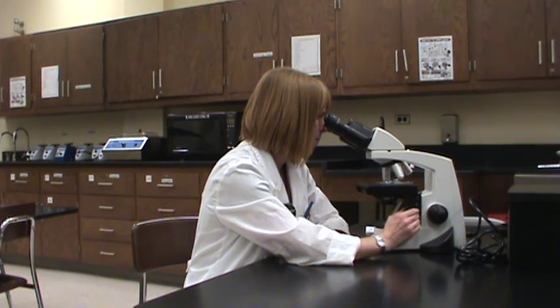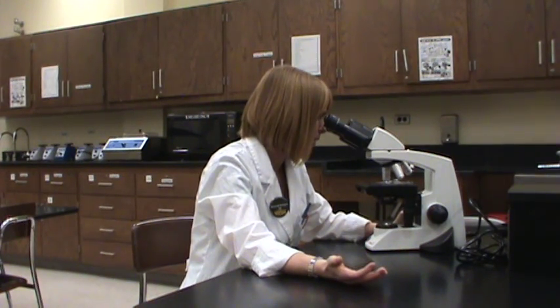Typically, what I would suggest in this situation is to find something that's relatively dark — that's a good starting point. I've got something, it looks relatively dark, it's in the center, it's in focus. Now I'm going to apply oil. This is microbiology class — in other classes you may have used the high dry lens, which is the 40x lens. Here in microbiology, because we're looking mainly at bacteria and the average size of a bacterium is about 2 micrometers in diameter, you really need oil.